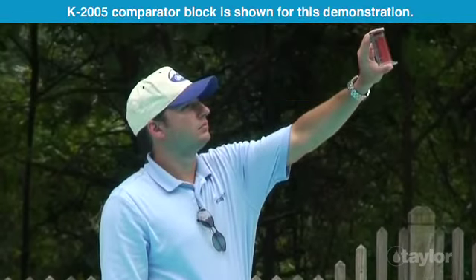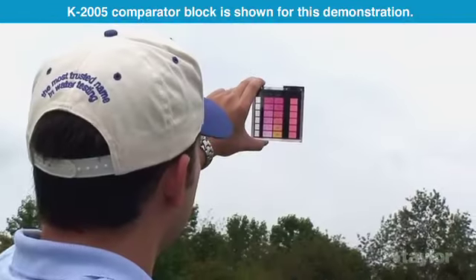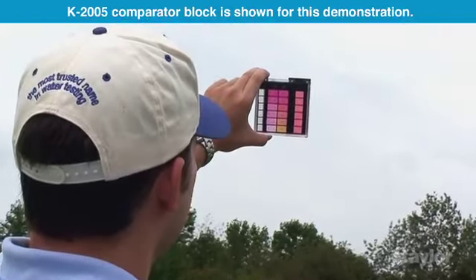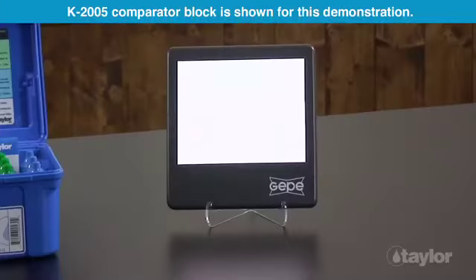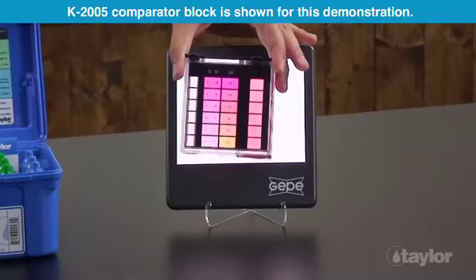Color matching should be conducted outdoors in natural northern light, or indoors with the aid of a daylight simulator.